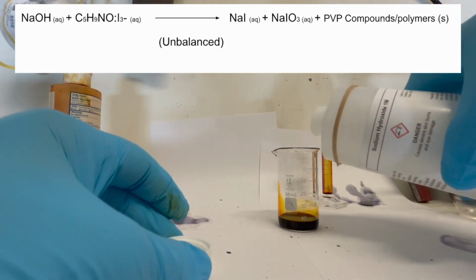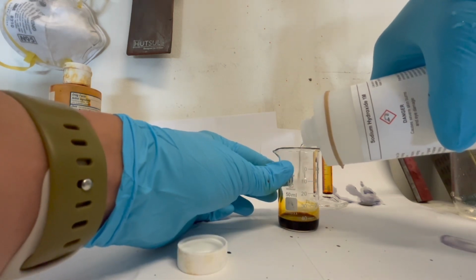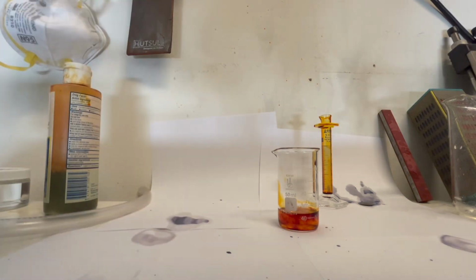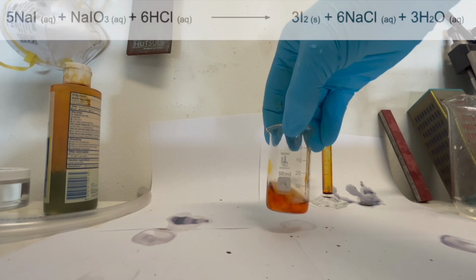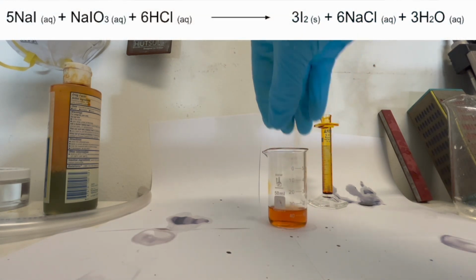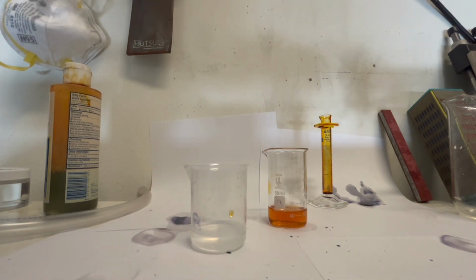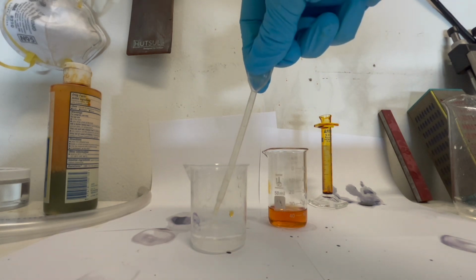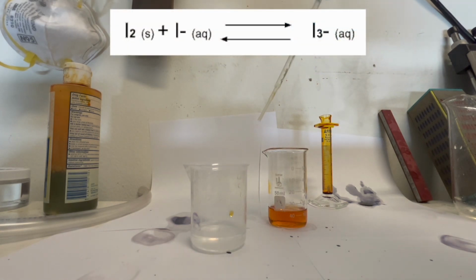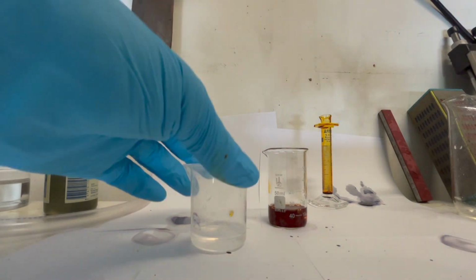The sodium hydroxide decomplexes the triiodide from the povidone polymer, and we obtain sodium iodide, sodium iodate, and some povidone derivatives, which settle at the bottom in larger solutions. I then add a dropper full of hydrochloric acid, which converts the iodine from both the sodium iodate and sodium iodide into molecular iodine, sodium chloride, and water. I purposely add only 1 milliliter of the 20% hydrochloric acid because we don't want all of the iodine to be oxidized, because we want the formation of the triiodide complex.